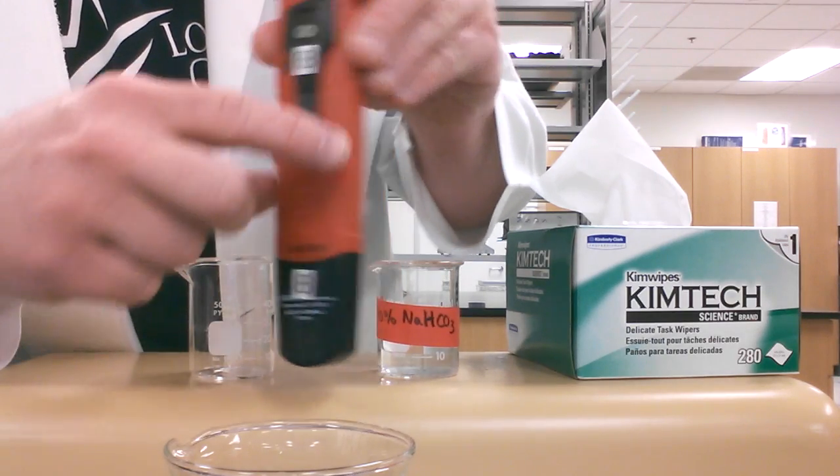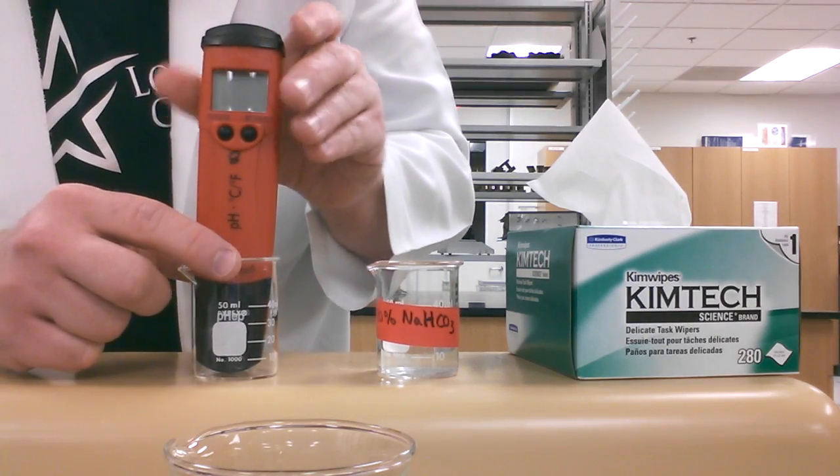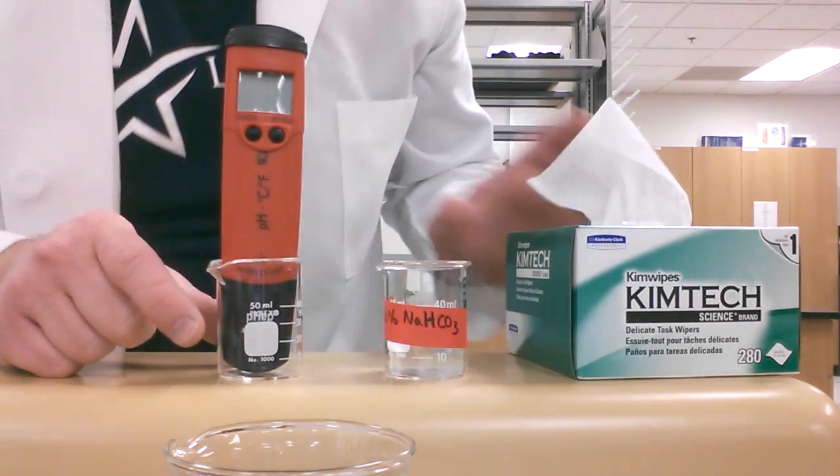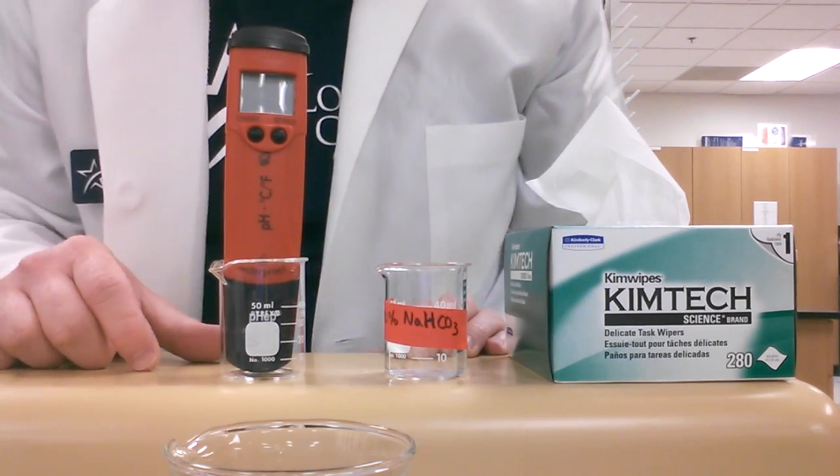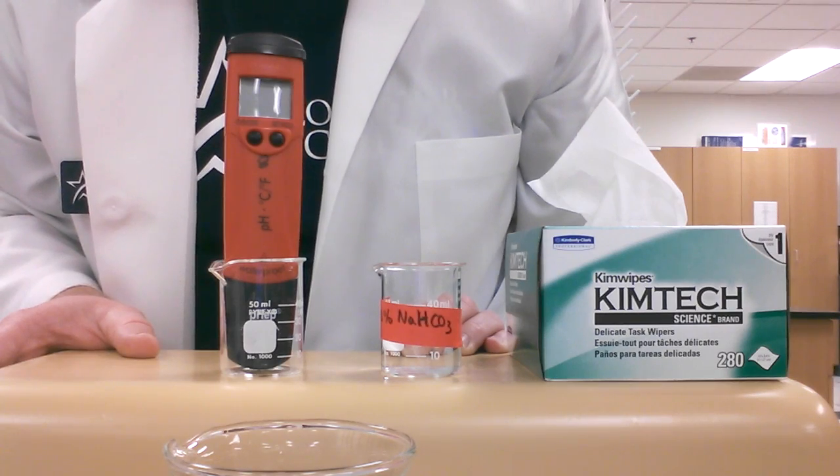Basically, that's how you're going to use this instrument. If you have any questions about calibration of this piece of equipment, then you will have to talk to your instructor.